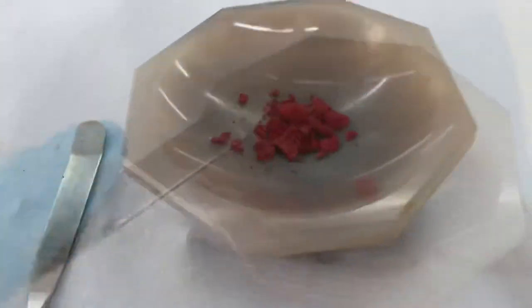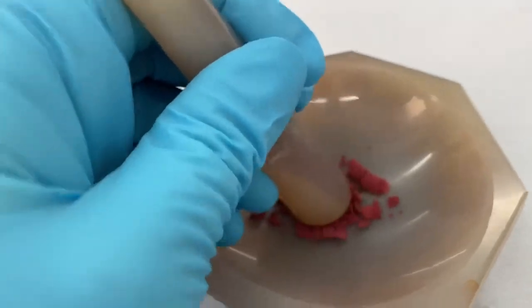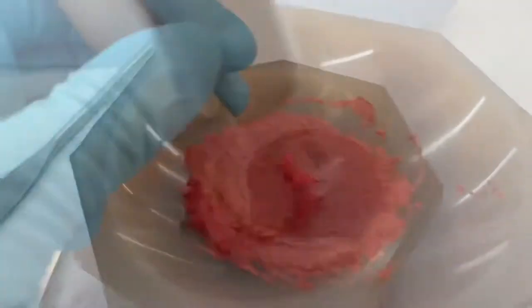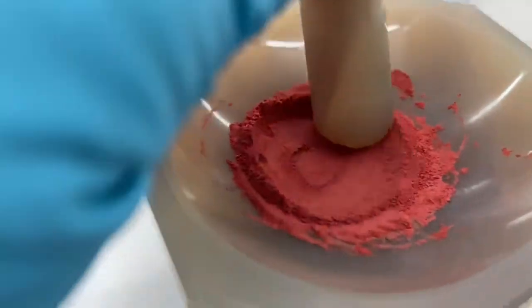Carefully these chunks of pigment are added to a mortar and pestle and ground slowly and efficiently until they reach a proper pigment.